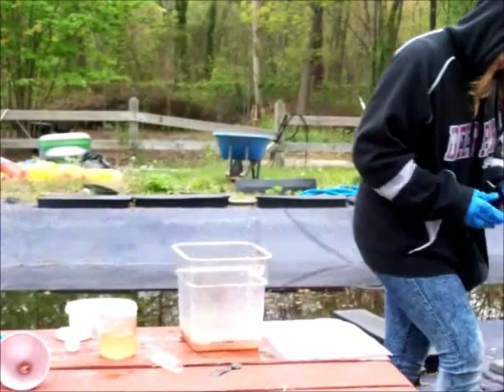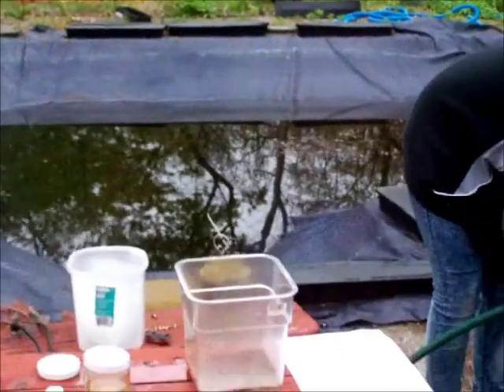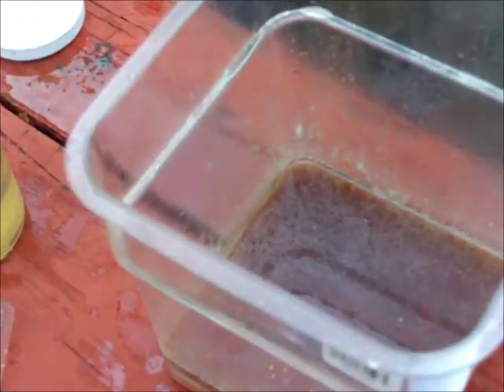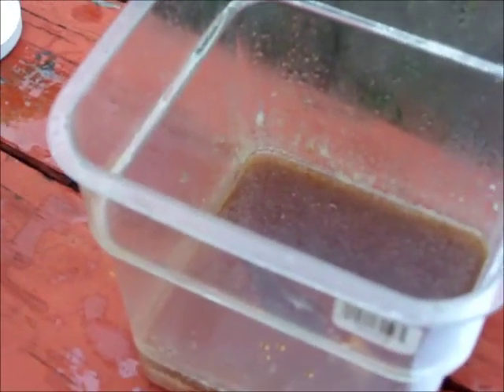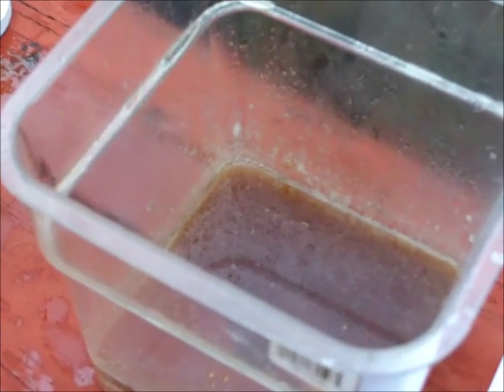As you can see there is a slight bubbling reaction. For the purposes of this experiment, I'm going to add the same amount of water and dilute the hydrogen peroxide to a 17.5% concentration. As you can see, it is a very slow reaction. What is currently taking place is the Fe plus 2 is reacting with the hydrogen peroxide, H2O2.